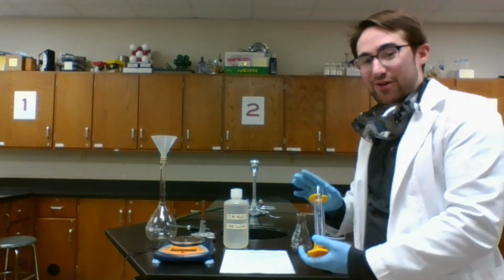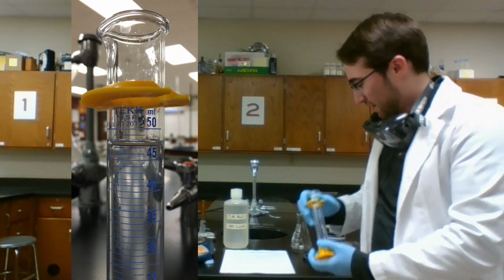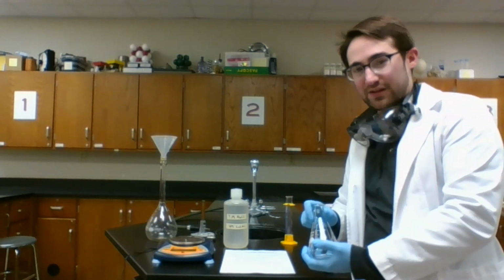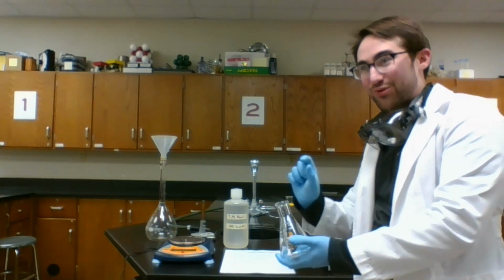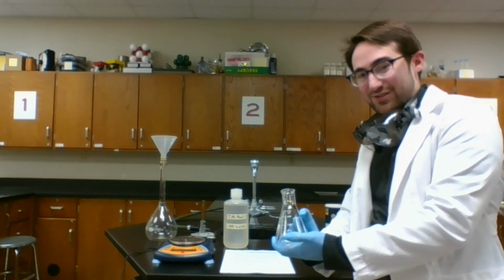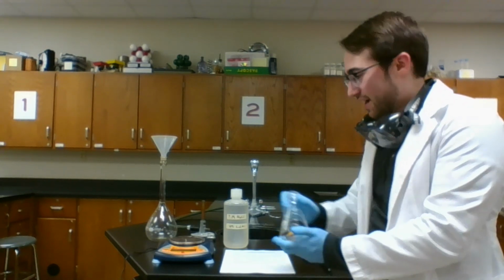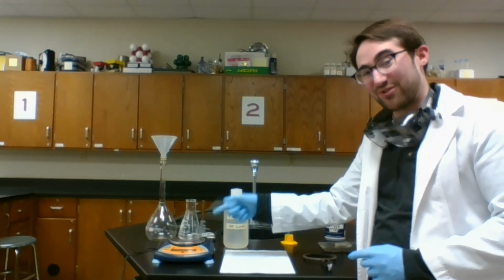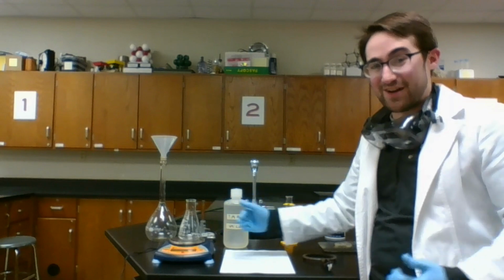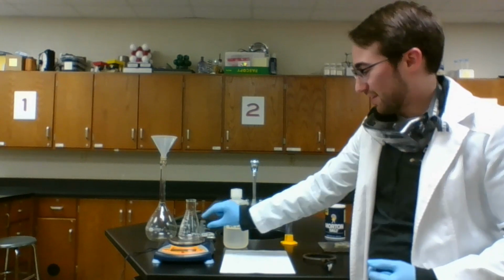So if I can measure out my original volume of solution of some unknown molarity, some unknown concentration, and transfer it into this flask, I know the liters of solution that I'm starting with. If I want to calculate the molarity, I want to know the moles of salt in that volume, that liters of solution. So I need to boil off the water, see how much salt is left. I will measure it in grams. Okay, so I'll need to subtract out the mass of the original flask compared to the salt that is now added in there. Once I have grams of salt, I can convert that into moles. Moles divided by my liters of solution is going to be my molarity.